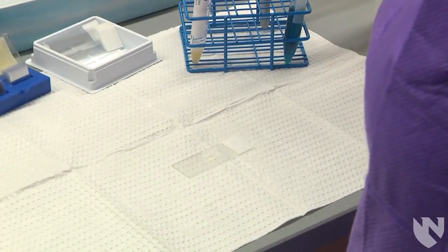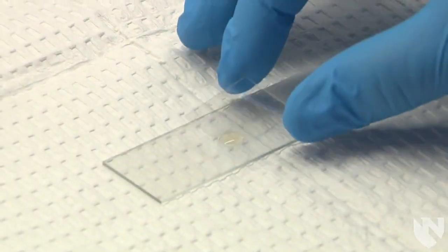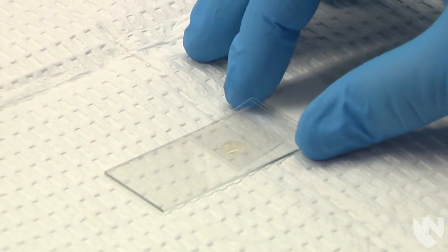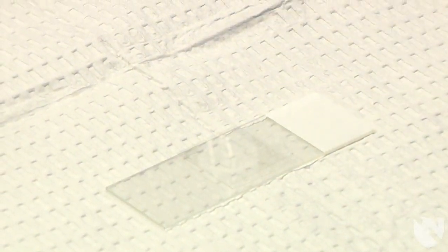Try not to get any bubbles in the pipette. Place only one drop of urine on the glass slide. Place the cover slip over the specimen.